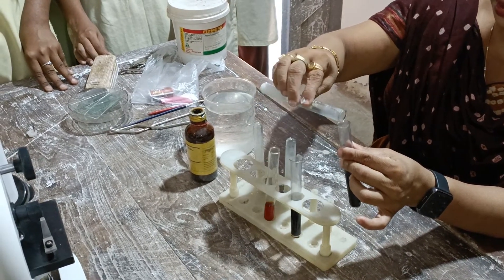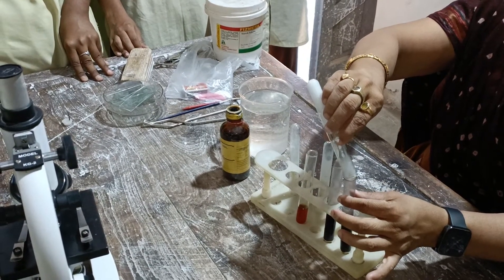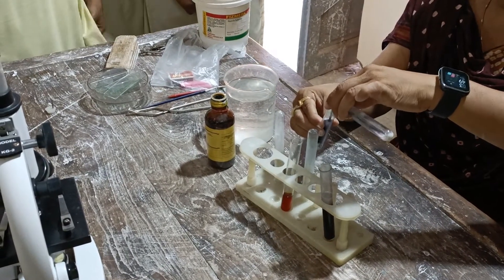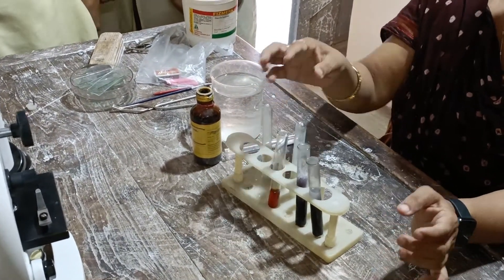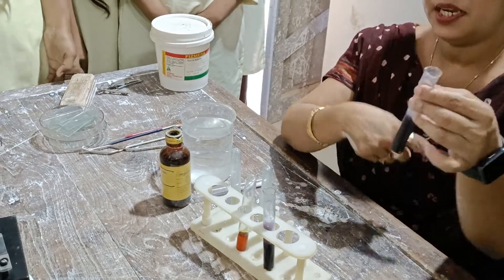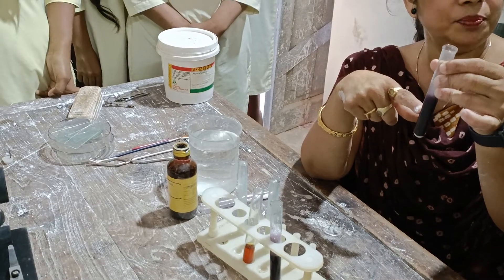I have done this. Now let's see the result — the color of iodine with starch is blue-black. We have got a clear result. It's the ptyalin enzyme. Now it is time to observe the starch result.